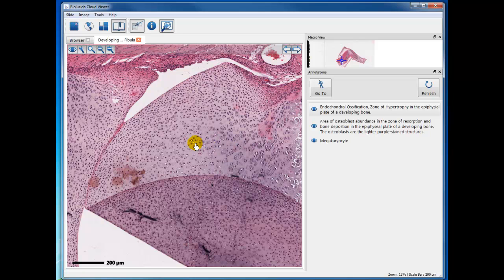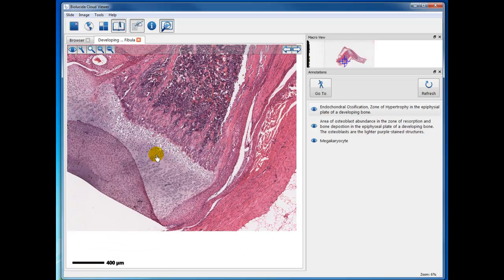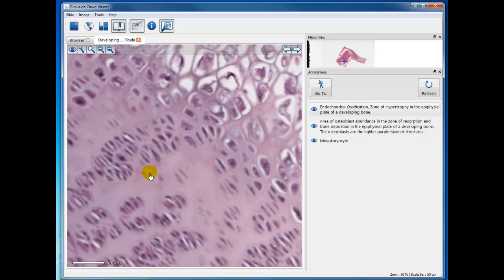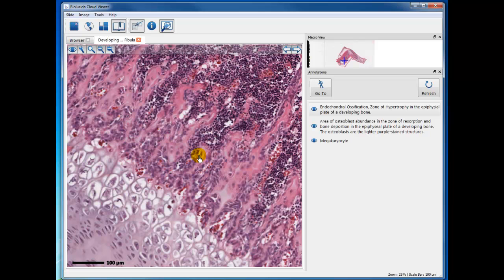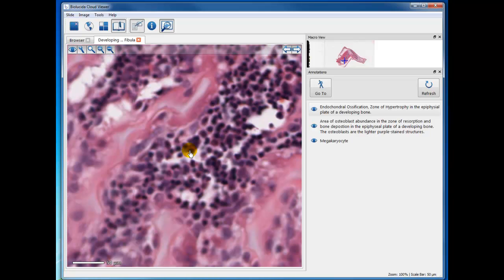And you can see all the cartilage, and you'll be able to study the development of the bone. And actually it's a little bit better than the last specimen in that you will see the zone of proliferation here, the cartilage, and this is the zone of enlargement, and then here you have the zone of the calcified cartilage upon which you get the formation of bone by osteoblasts.